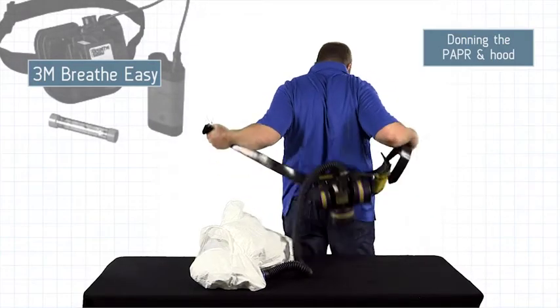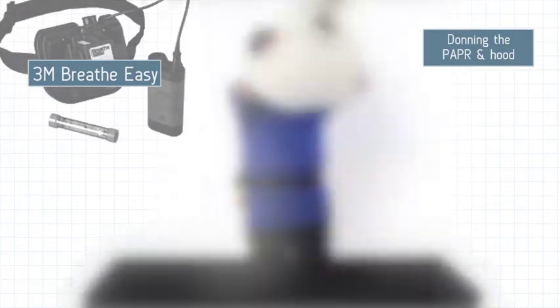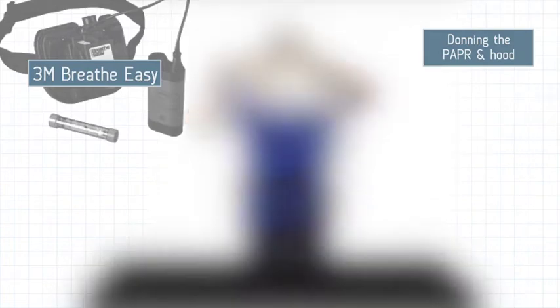Don the PAPR. Place the hood over your head and adjust for comfort and breathing tube alignment.